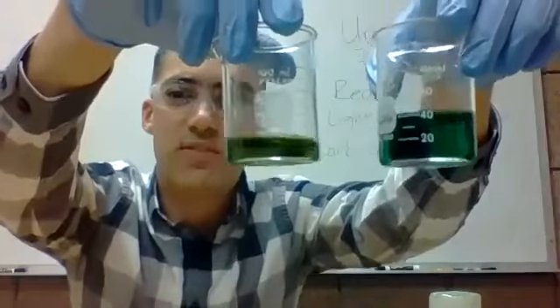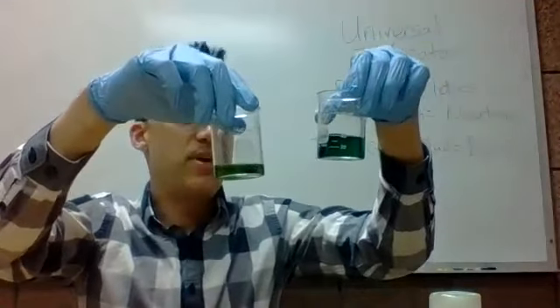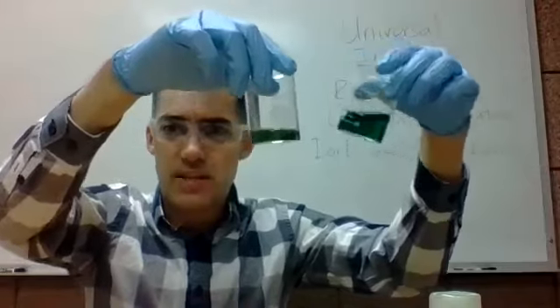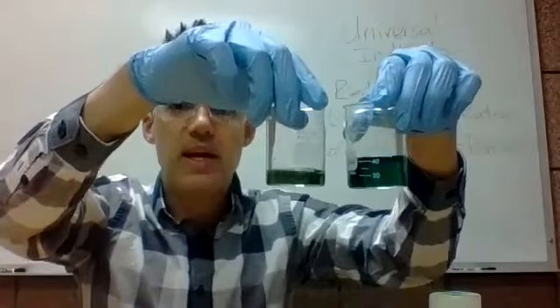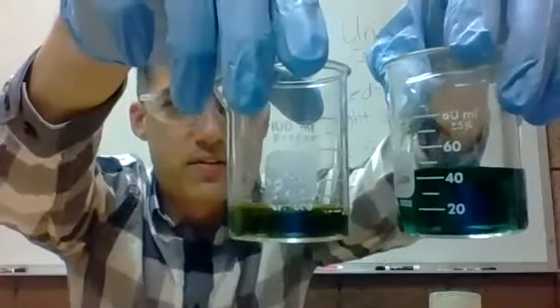And you can calculate the pH of it, and you'll find that it's just slightly basic. I think it's got a pH somewhere around 8, whereas DI water would just be at a 7. So it's just slightly basic, and we do see a slight difference in the colors here.